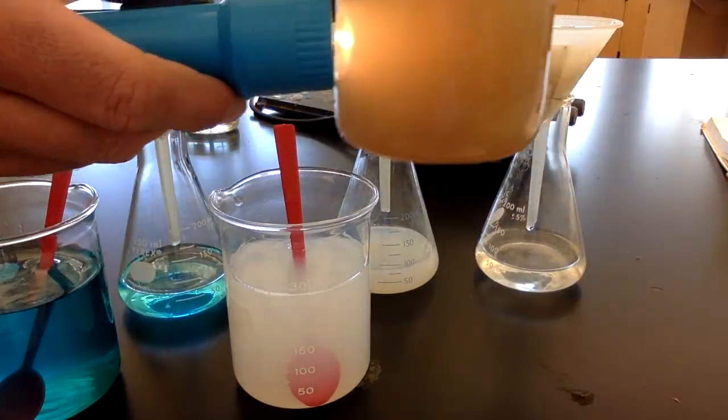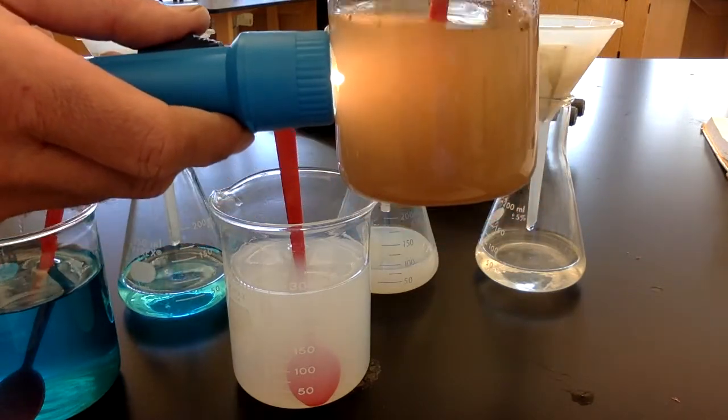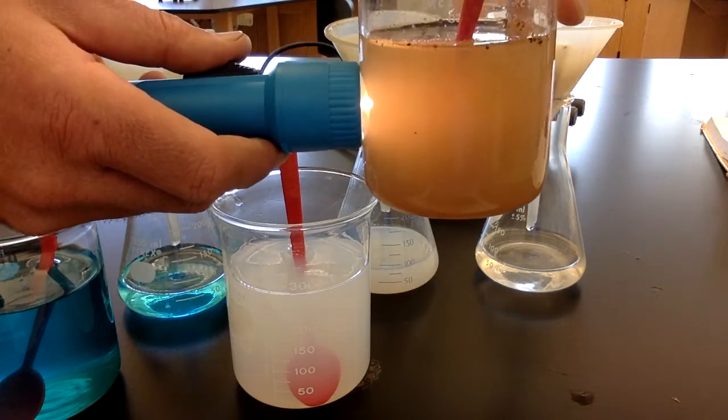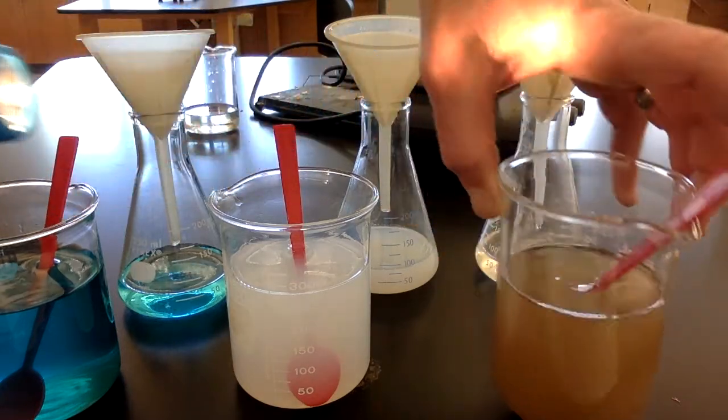And then through this one, the cloudy one, the light just kind of gets blocked. So the light does not pass all the way through. I know it's a little hard to see this on the video, but the light goes maybe halfway through this, and then it doesn't really pass through the other side because it's being blocked by that liquid.